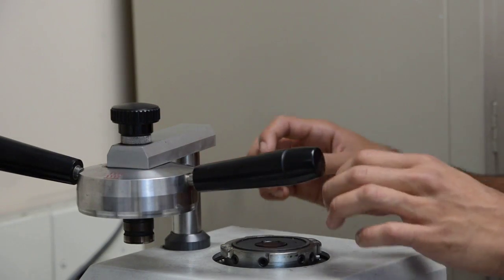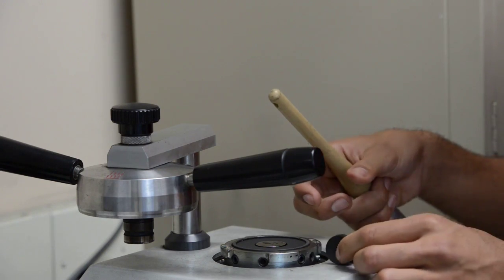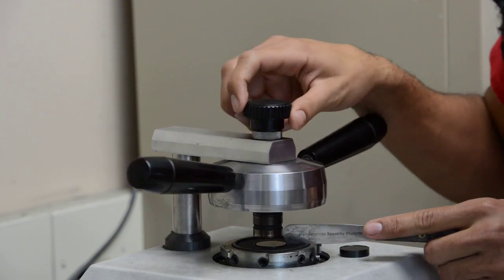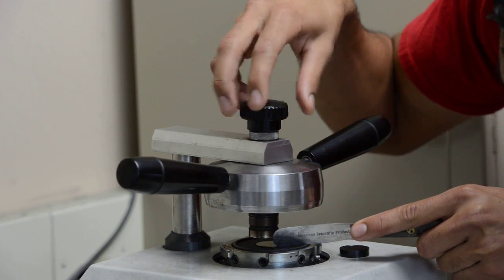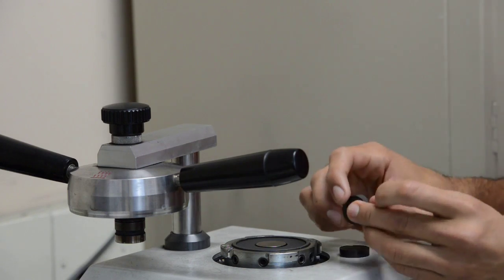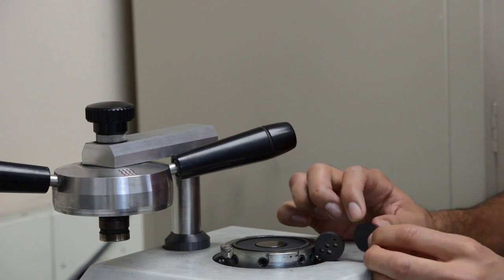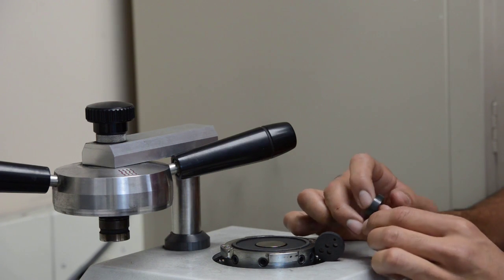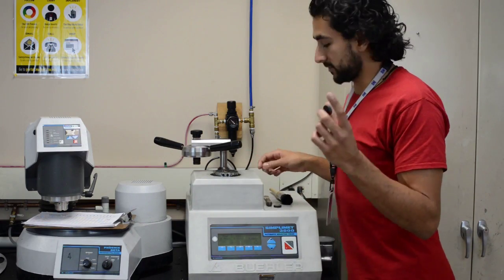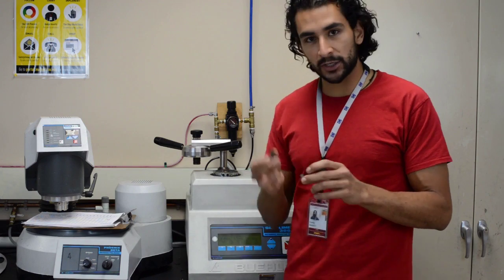Now, make sure you clean everything after you're done. Take your puck out. This is what a dummy puck looks like. Clean all the excess conductament. And for the next person who's going to be using this machine, you want to peel off that layer of conductament that is on this piece of metal, so they don't have trouble using the machine. Now, the previous dummy puck I made had some holes for my samples. I need to go and drill holes in this sample and sand the edges a little. Sand off the edges so it can actually go back in here and will put my samples on it and fill with more conductament. Hopefully you have used a drill press before and a belt sander. If you have not, make sure you ask Bill before you use these. So let me go drill some holes and I'll be back.